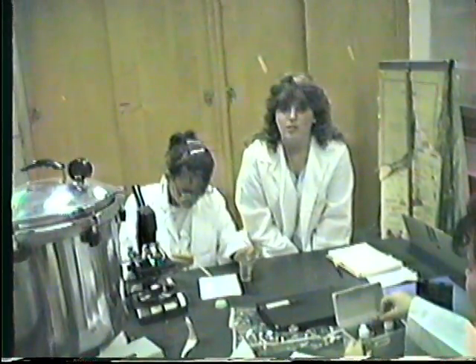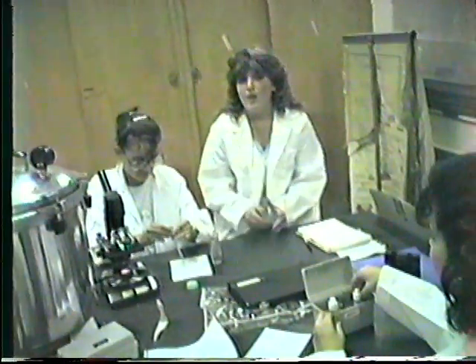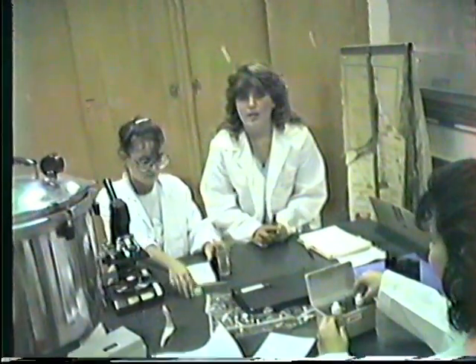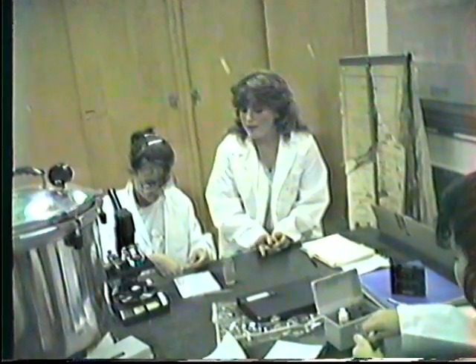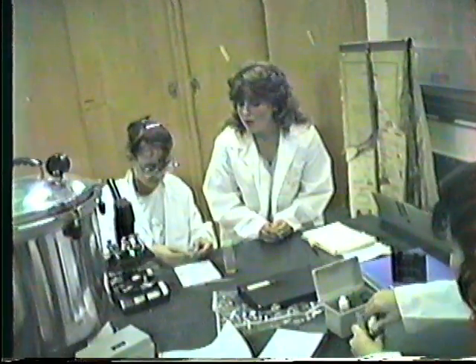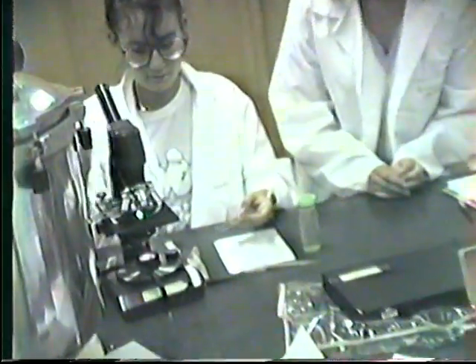Ecology is the study of living organisms in relationship to their environment. Limnology, which we are studying, is actually freshwater ecology. We're studying the living organisms in and around the lake in relationship to the physical factors in the environment. Limnology is actually divided into 3 sections. We have our biological, physical, and chemical section. Right now we're working on a biological section where we are working with identifying microscopic organisms.